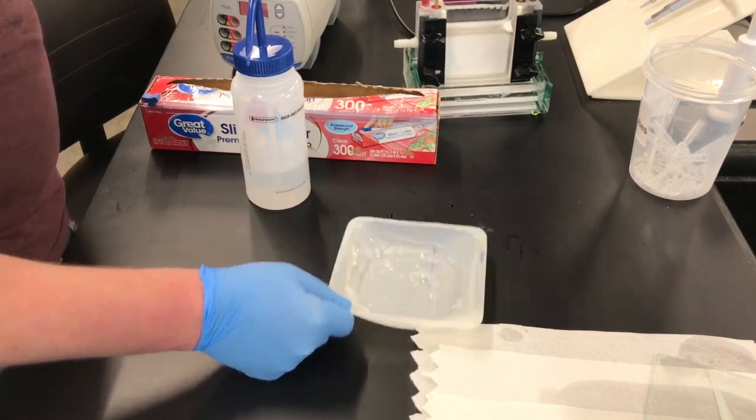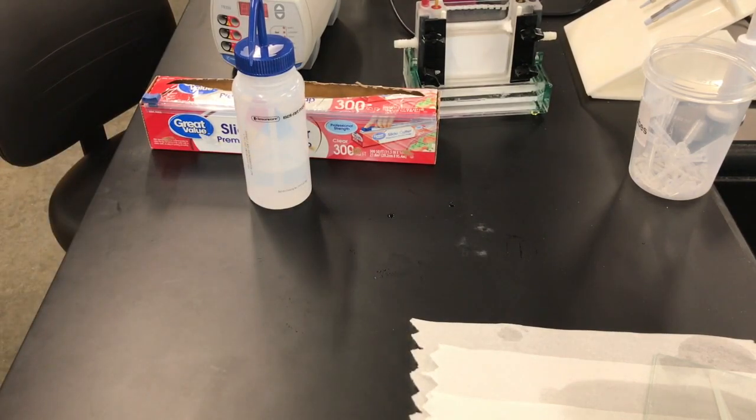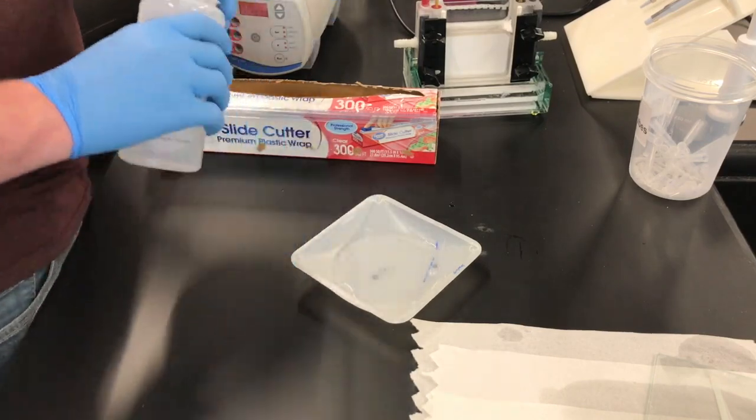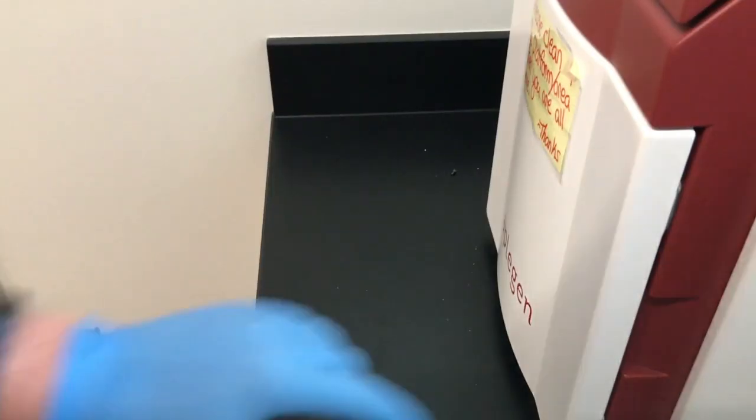Rinse it off around two or three times, draining the water each time. Then, store it under a little bit of water until the next part.